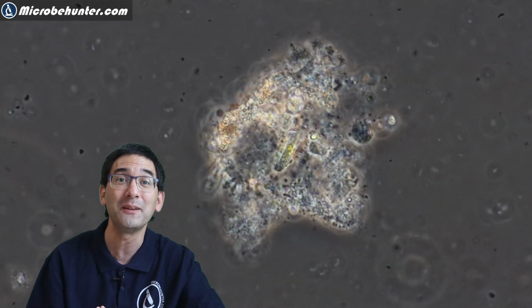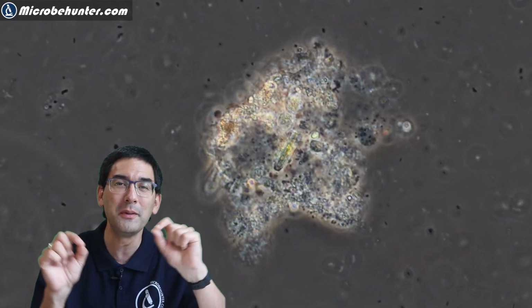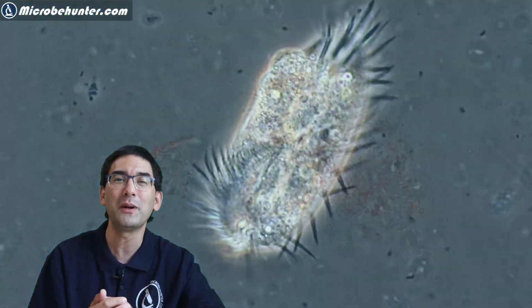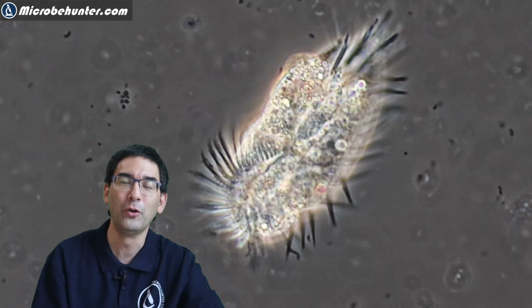Now if you look very carefully, you're going to also see a lot of bacteria swimming around in the medium, and here you do not see them quite as well because this one is now using a different contrasting technique called DIC, and DIC gives nice images as well, but sometimes the structures cannot be seen quite as well compared to phase contrast that I have over here.